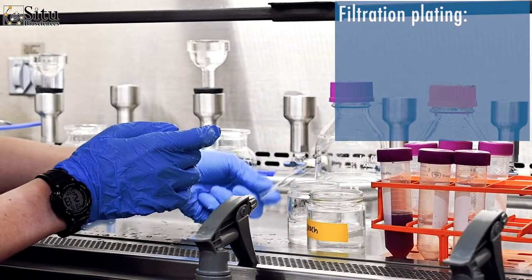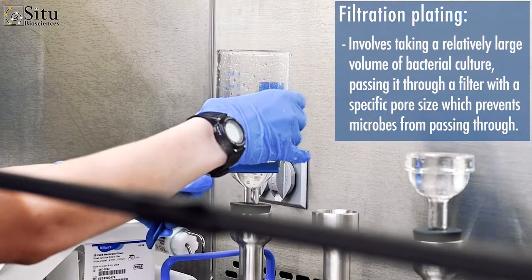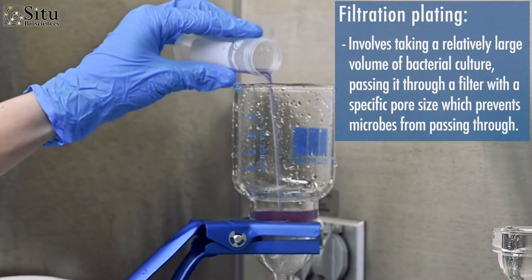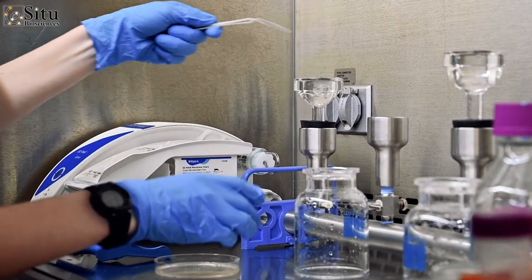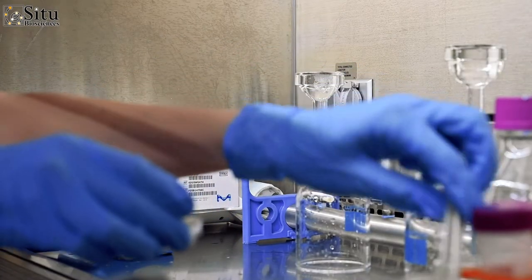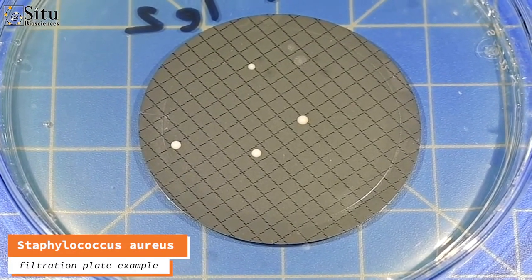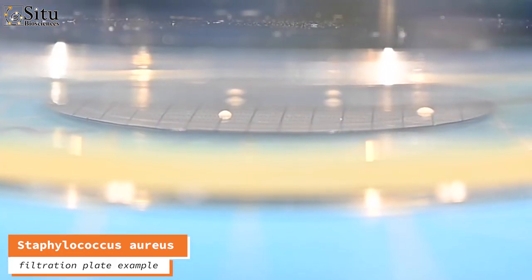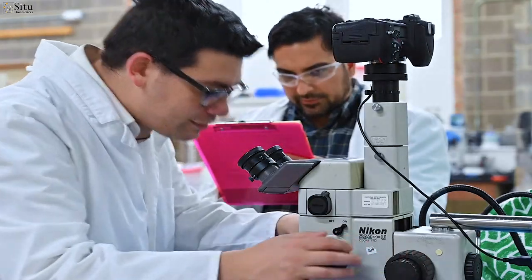In filtration plating, a relatively large volume of bacterial culture is passed through a filter with a specific pore size, which prevents microbes from passing through. The filter, with the captured microbes, is then plated on an agar medium and incubated to facilitate colony formation. This allows for the accurate determination of colony forming units in a culture, which is particularly useful when determining the concentration of dilute cultures.